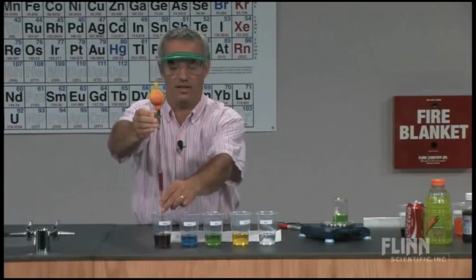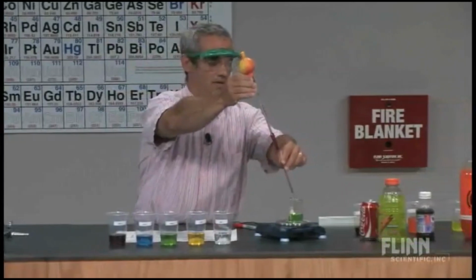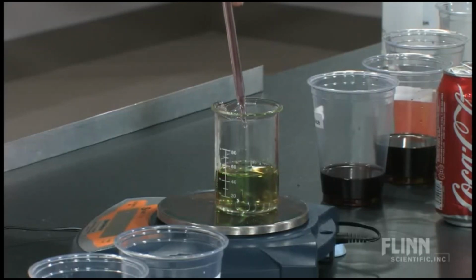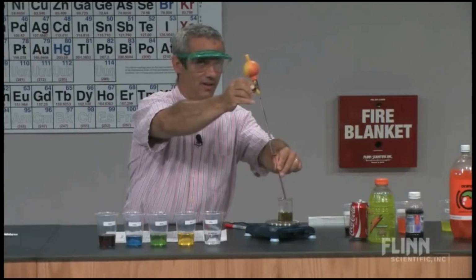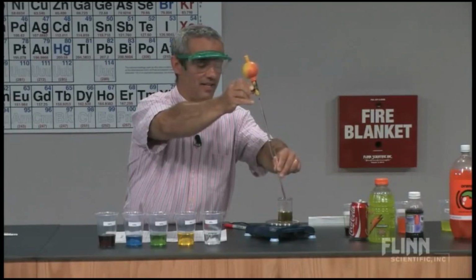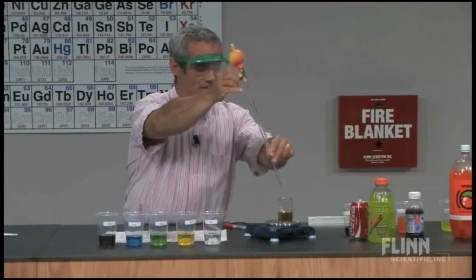And there we go. It's been zeroed. I remember this time. You get some nice little color changes taking place in that beaker, but that's kind of irrelevant. Not a chemical reaction, just a physical process as they mix. They mix so well because I keep on putting the denser one on top. If I'd gone in the other order, I'd probably have a nice little density gradient rainbow in there. And this last one now, that last drop does show up as a couple extra.